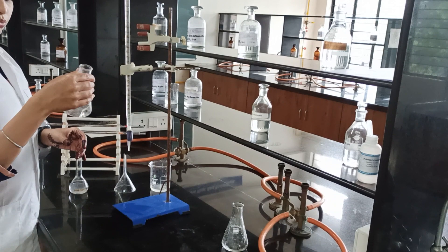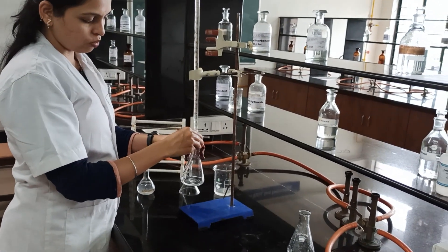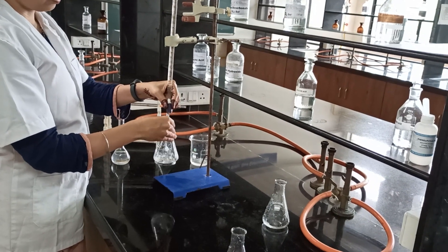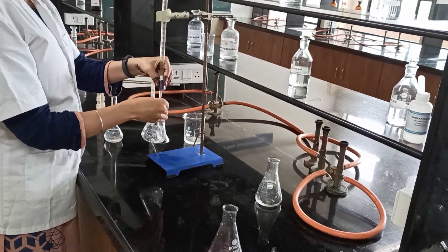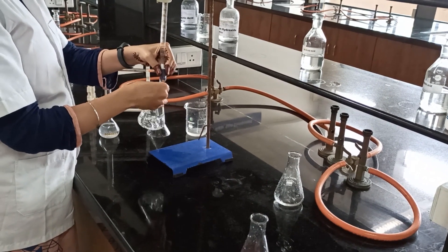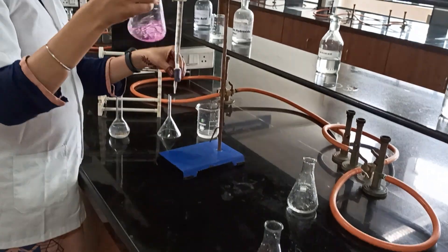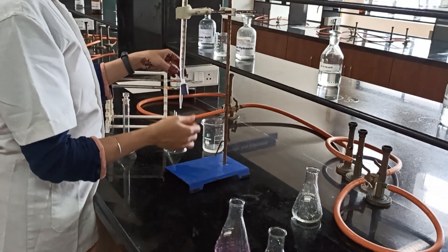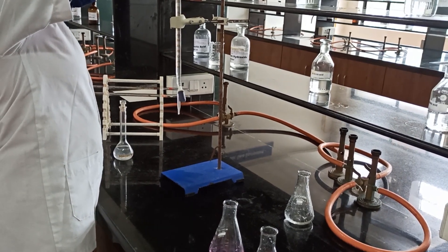Again, I have taken 0.1 gram of potassium hydrogen phthalate dissolved in 15 ml of water, and 2 to 3 drops of phenolphthalein indicator was added. Now we have to titrate this content again with 0.1 normal NaOH. The color change is colorless to pink — you can see the endpoint for the titration is colorless to pink. Similarly, we will proceed for the third reading. Before that, fill up your burette up to 0 ml.